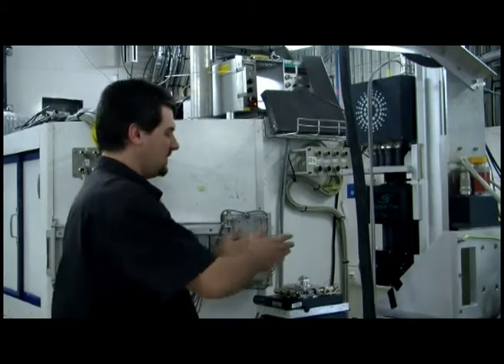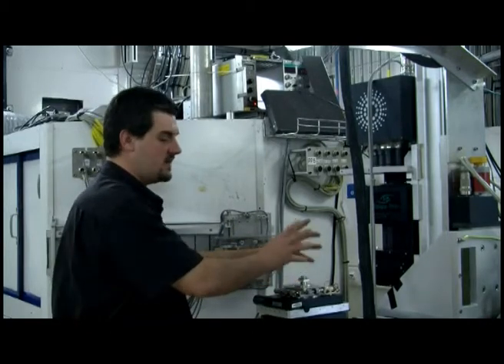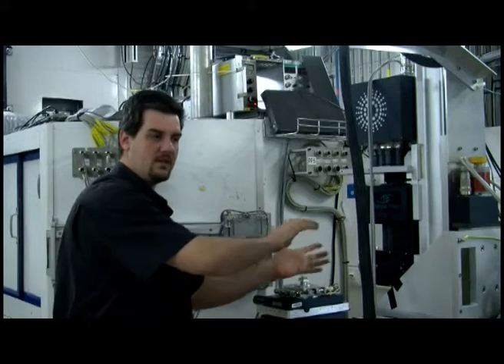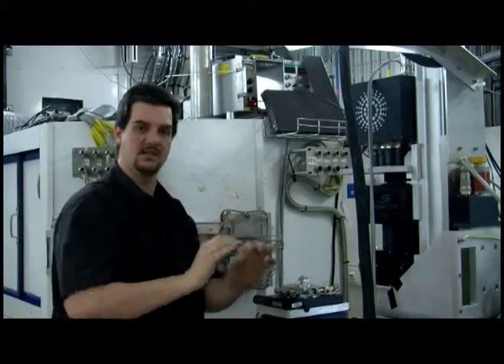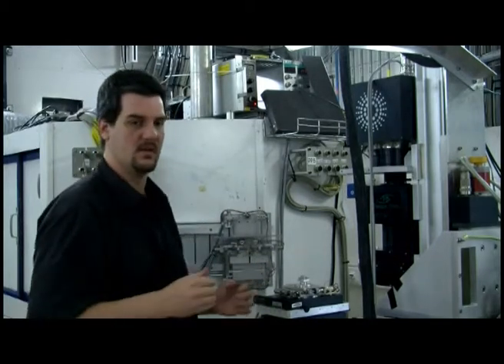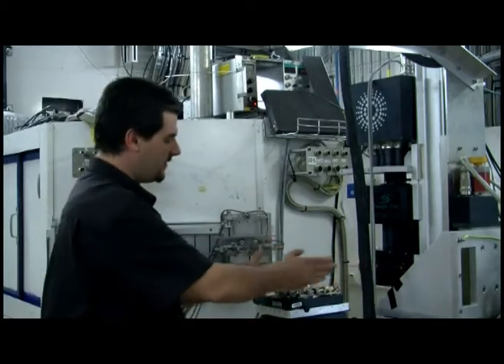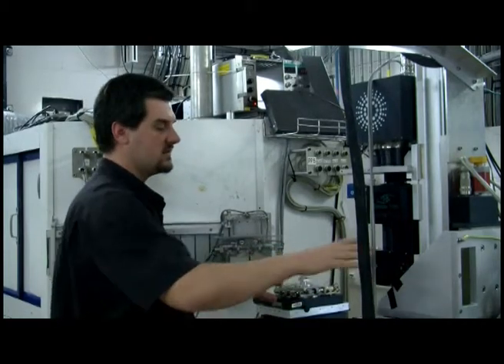So you have these very specific X-rays going through the sample, and each interface in the sample will create what we call an edge detection effect. So we'll see all the interfaces extremely clearly because we are using such kind of coherent X-rays. And to have that effect, we just have to move the detector. So you can see that it's on a big motor, a big translation.